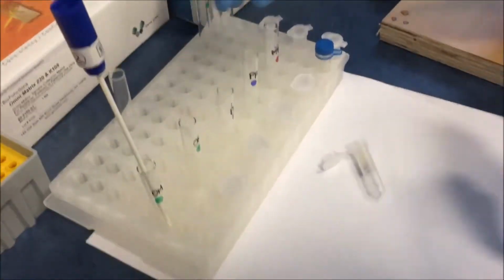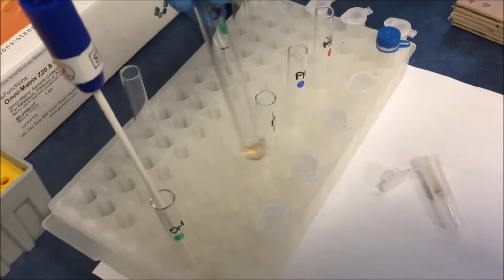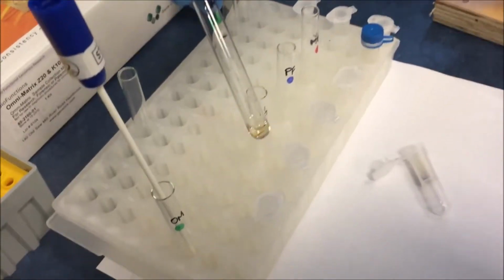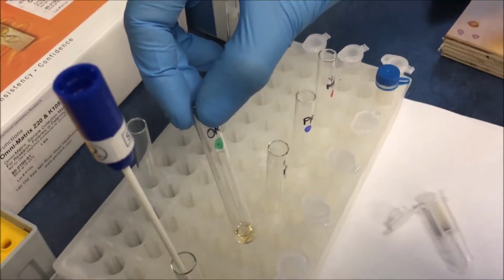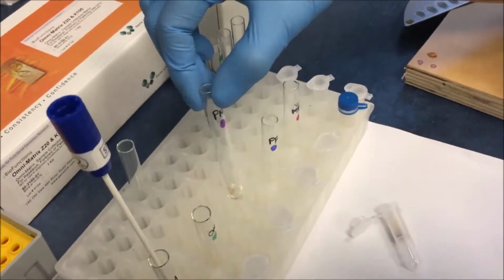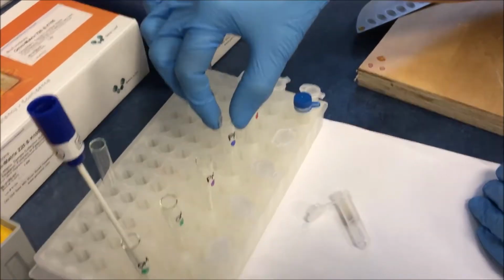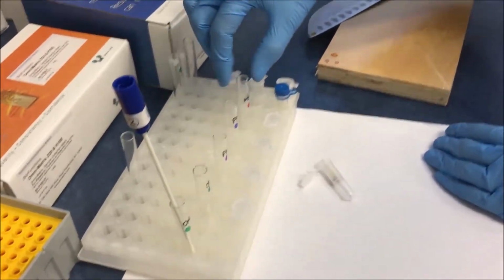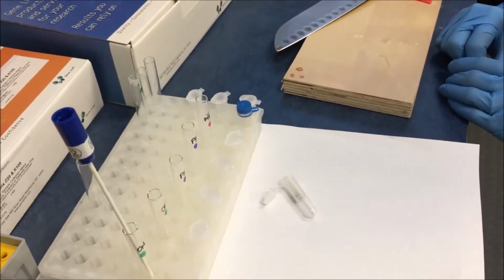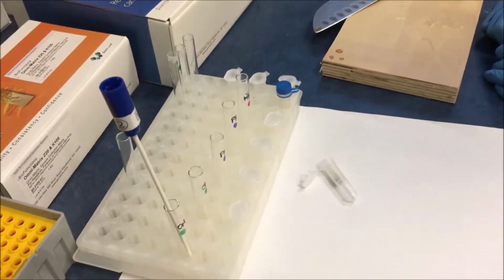The Omni-Matrix dissolves in the lysis buffer, and in this case it has been just 2 to 3 minutes, and you can see that there is hardly any Omni-Matrix left. What we will do is let it wait for about 5 to 10 minutes and then show you 100% dissolving. So the basis of the Omni-Matrix is that it is a dissolvable sample collection device, and after adding it to the lysis buffer it dissolves 100%.